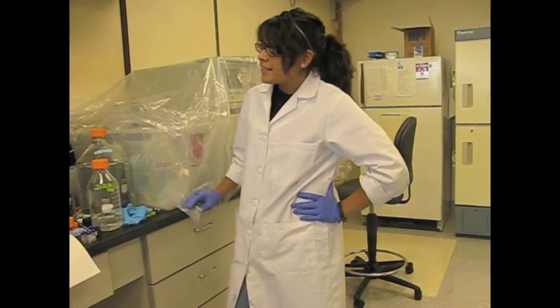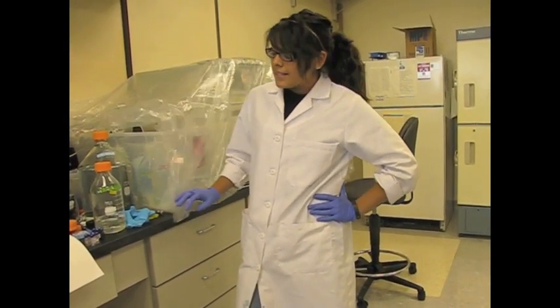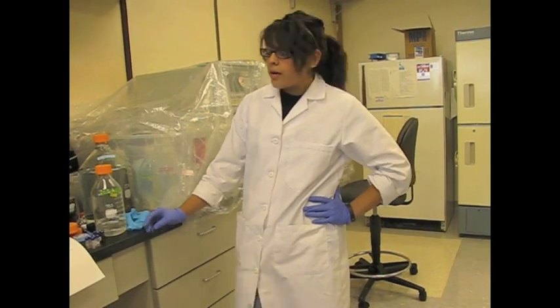The second step is loading the samples. Because this apparatus is very sensitive, only 100 microliters of the sample is needed, and it goes in here.